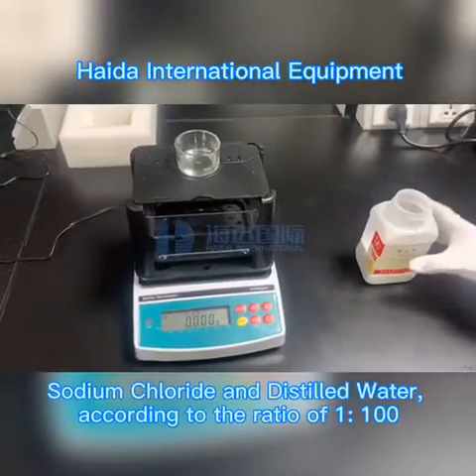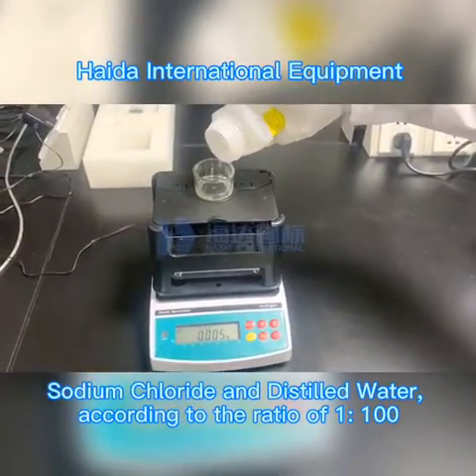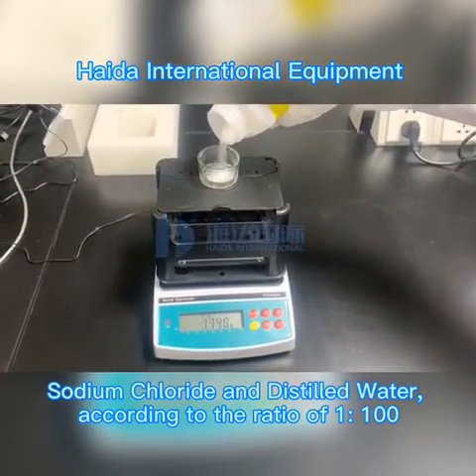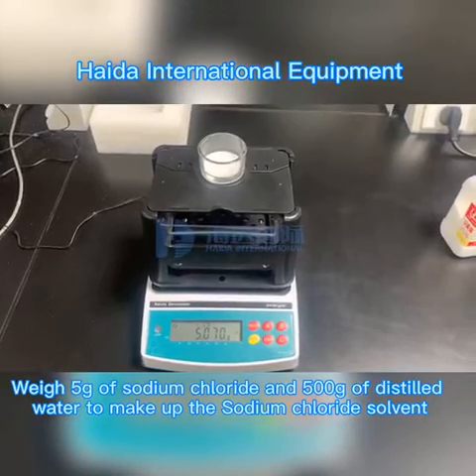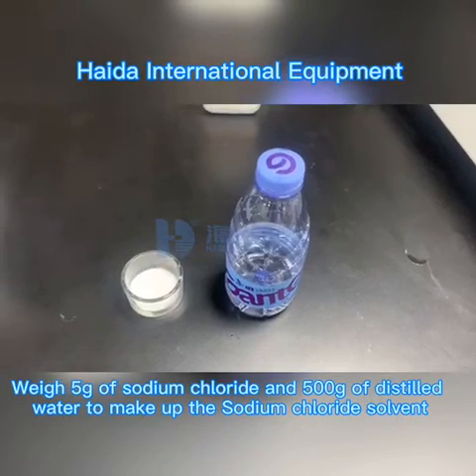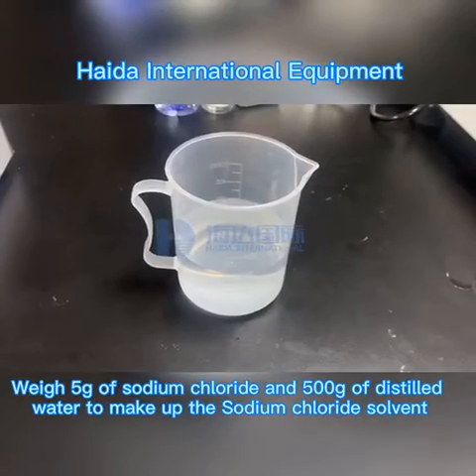Mix sodium chloride and distilled water according to a ratio of 1:100. Weigh 5g of sodium chloride and 500g of distilled water to make up the sodium chloride solvent.